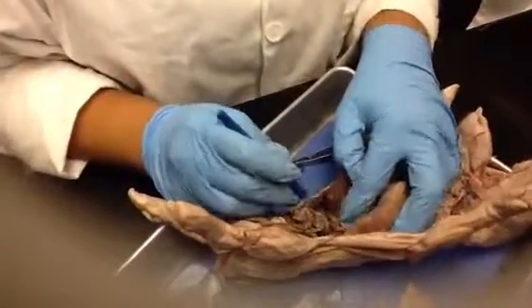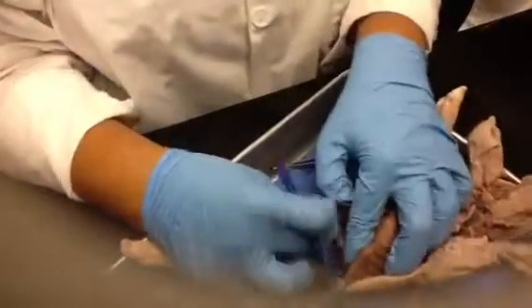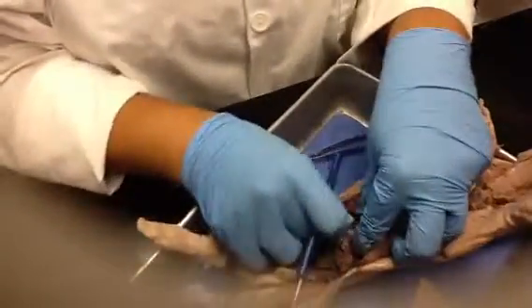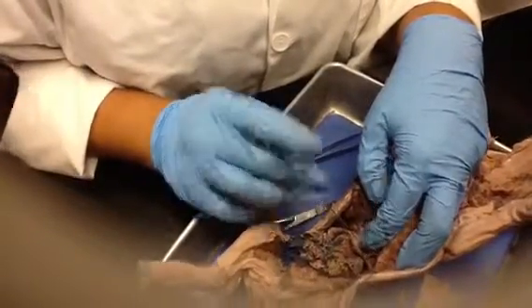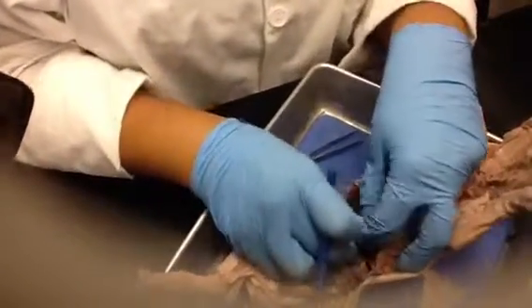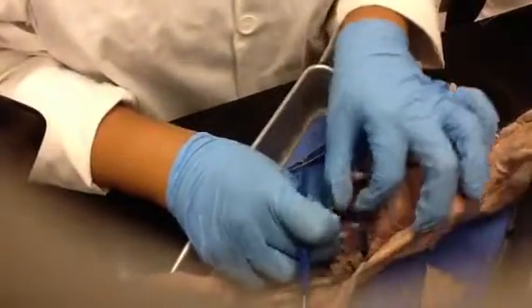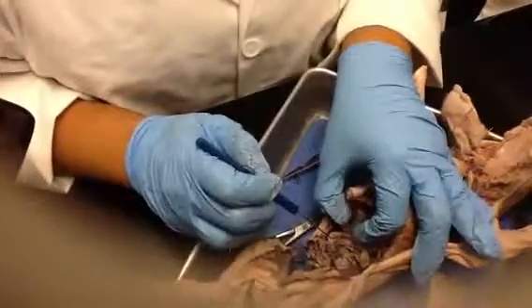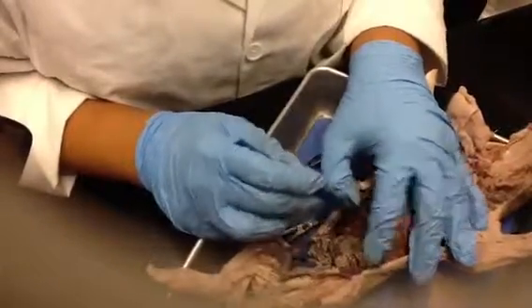So this whole structure right here is the stomach. Just beyond the stomach is going to be your pyloric sphincter, right in here. How you know is if you have gloves and you touch it, it's kind of hard. Then this is going to be your small intestine. Since this part comes right off of the stomach, you know this is your duodenum. If I were to put a pin here and you can clearly see the stomach, then you know that's the duodenum. And I want you to be as specific as possible.